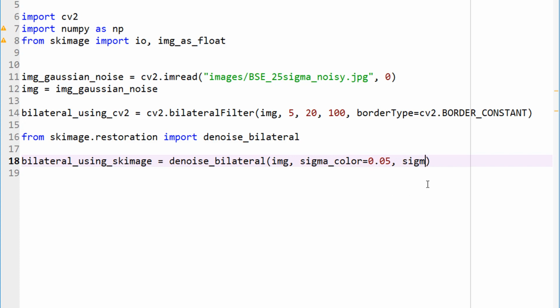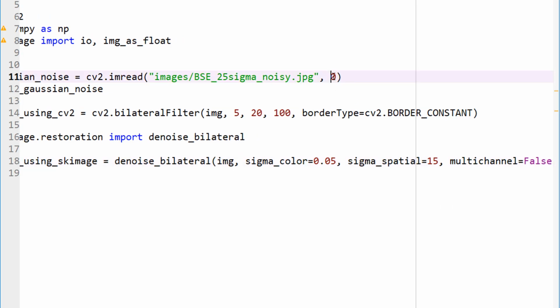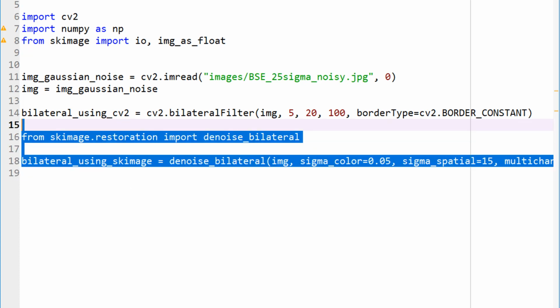And then sigma spatial, let's just give 15 pixels. The spatial is nothing but the value in pixels, right? So this is 15 pixels right now. Now, in addition, you can basically say multichannel equals true or false. So multichannel equals false because the image that we are importing is imported as a gray image. So this should be fine. Let's actually go ahead and run this and see if everything is okay.